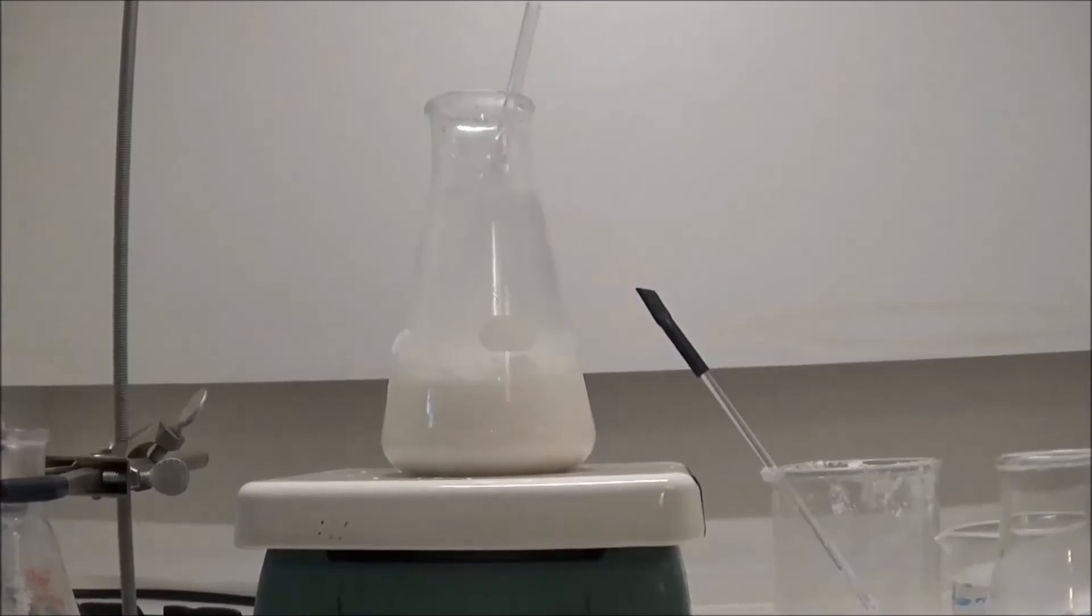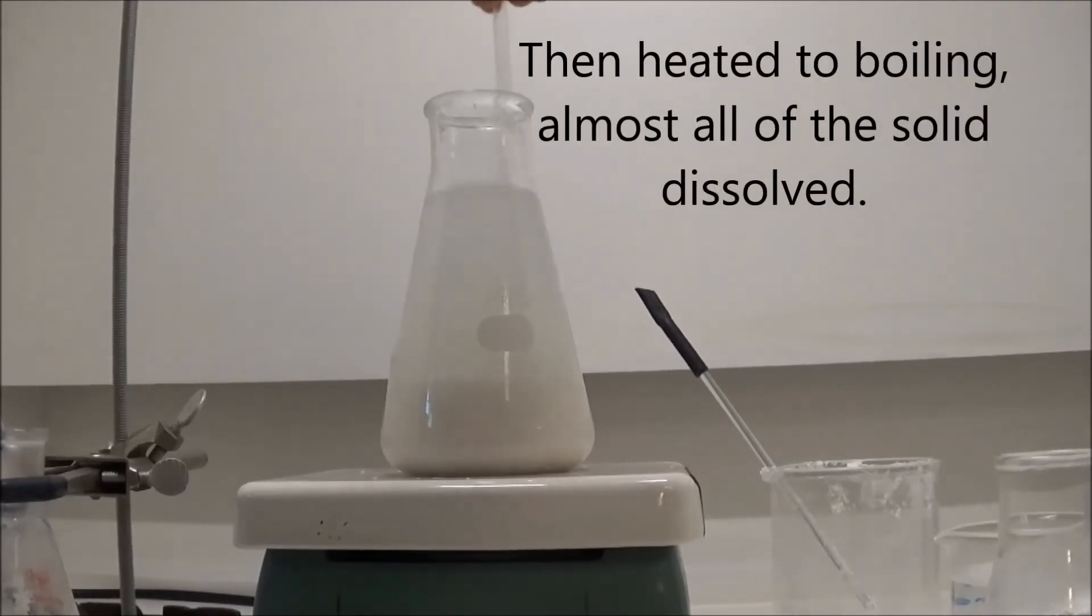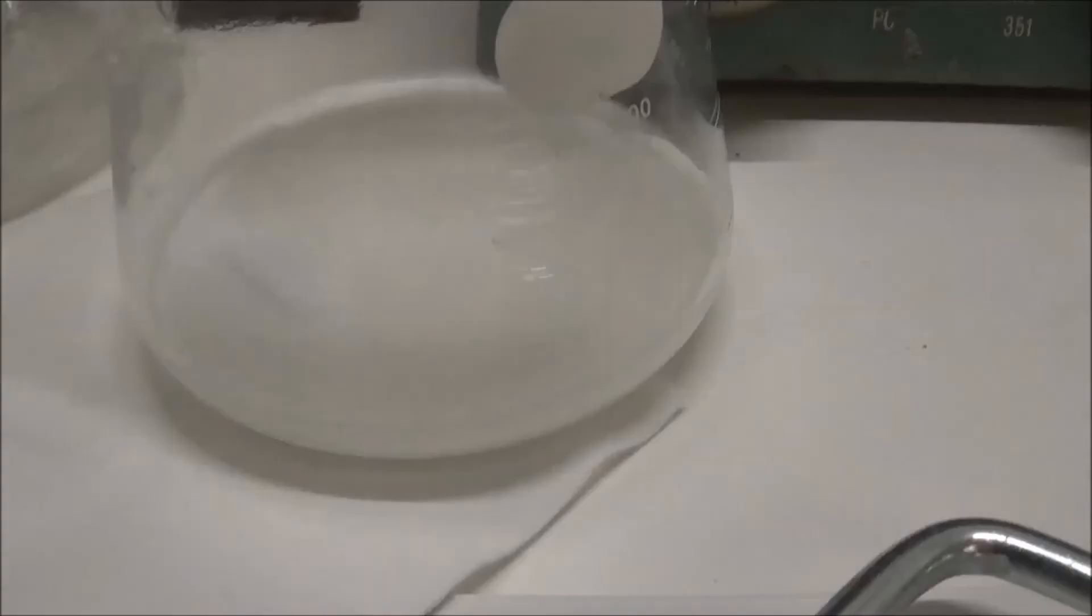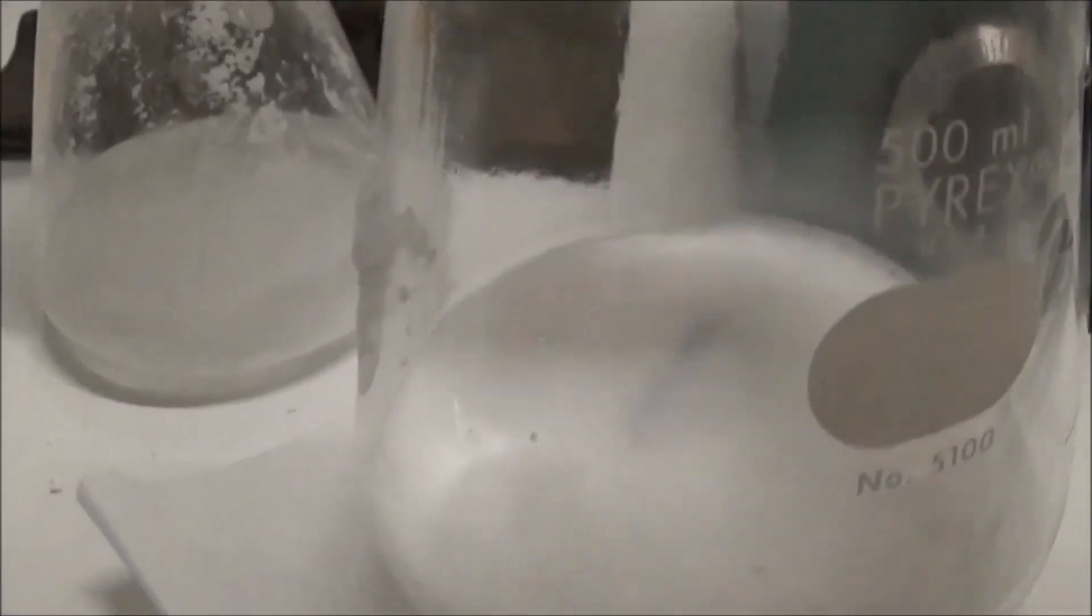Next, I added about 250 milliliters of a dilute ammonia solution. Some insoluble urea decomposition products remained, so I poured off the liquid into another beaker.